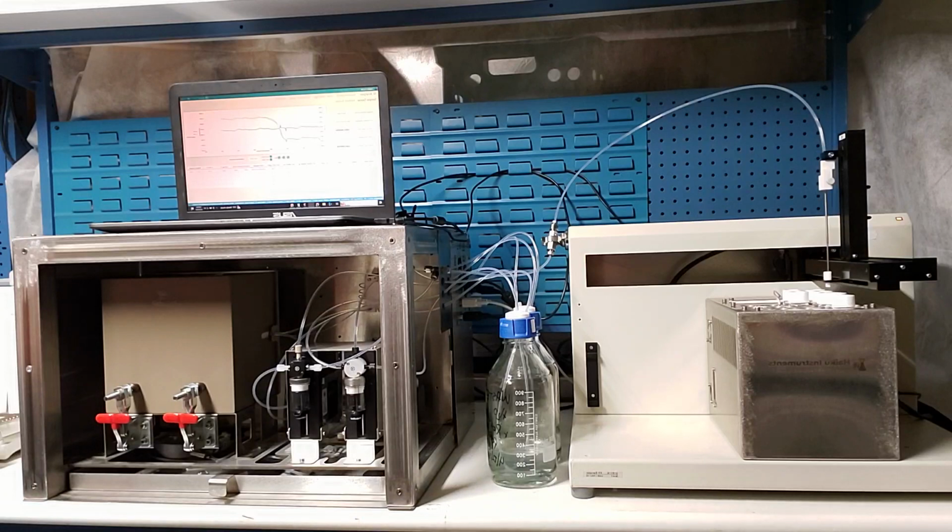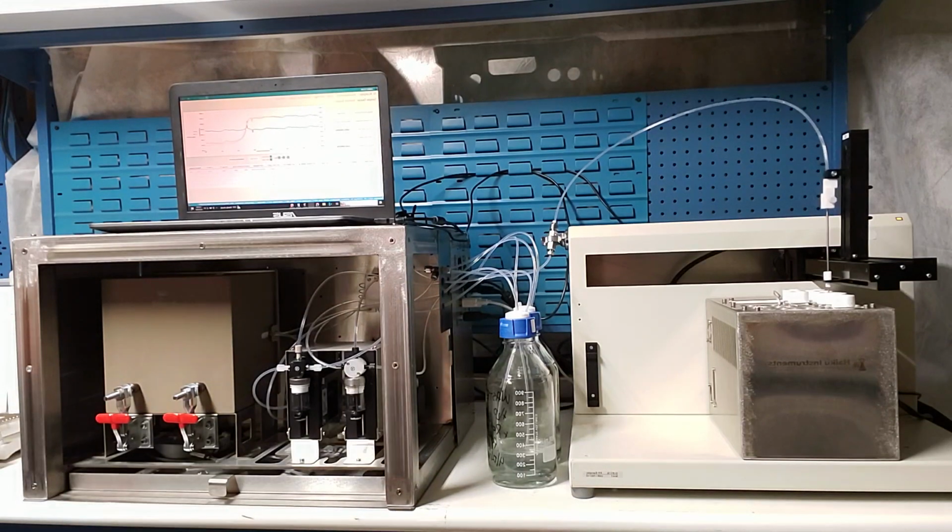Whether we run our samples at high or at low concentration, the intrinsic viscosity values obtained are identical. It is simply important that we run below the critical concentration at which you break out of the dilute solution criteria. That dilute solution criteria is that the polymer is not interacting. You're not getting multiple polymer interactions. The rheology that's going on in solution is being dictated by the polymer solvent interactions and not polymer interactions.